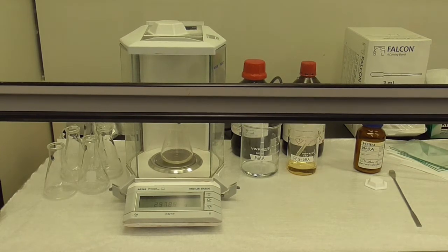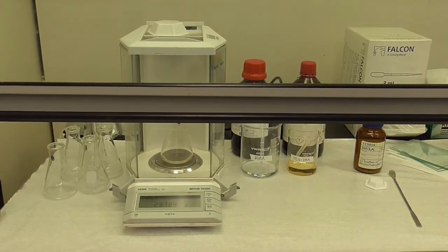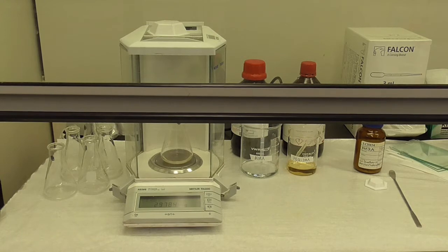Finally the photo initiator DMPA. We need 0.2 grams which we're going to weigh out in the weigh boat as it's a solid and put into our solution.